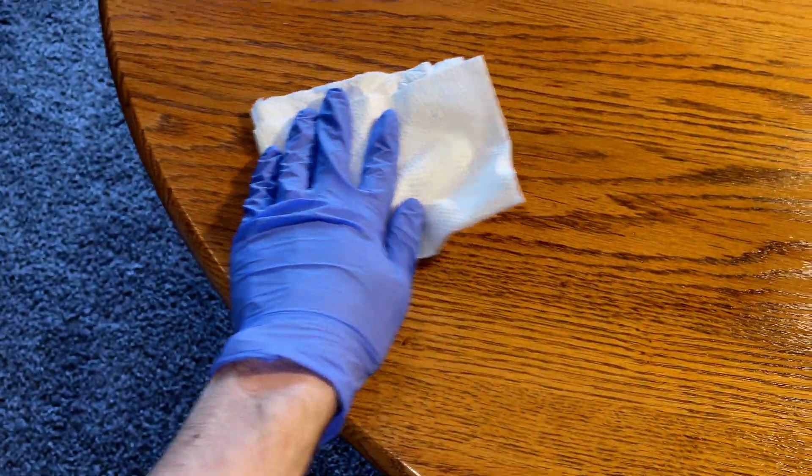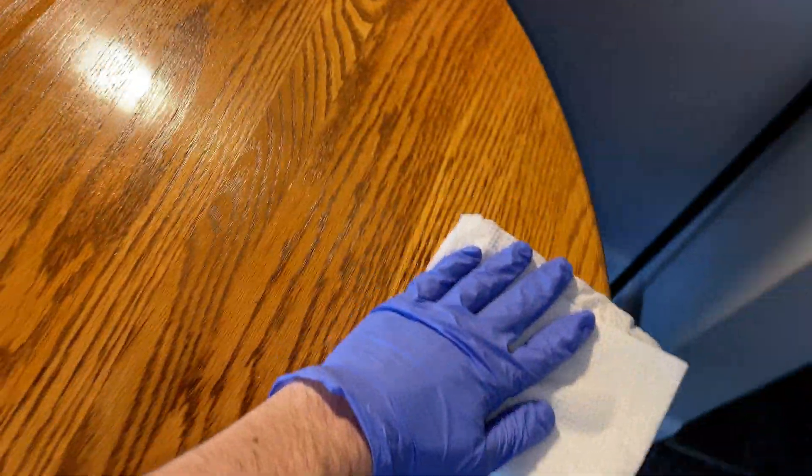First, make sure that your workstation is completely sanitized as you want the lowest chance possible of contamination while doing your SAB work. This is still recommended to do while you have a flow hood as well.